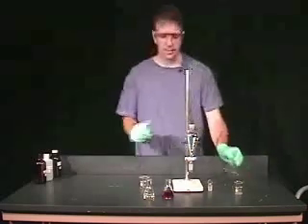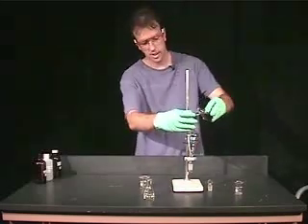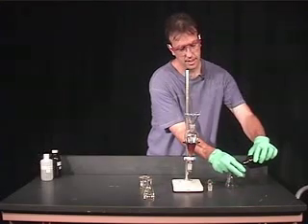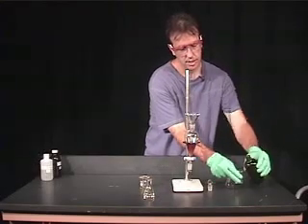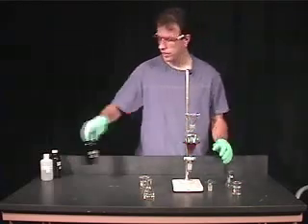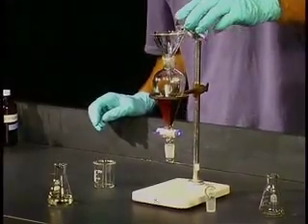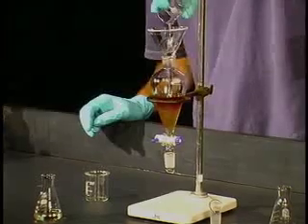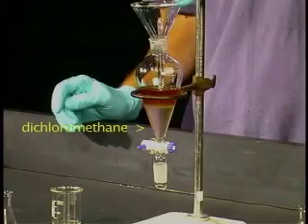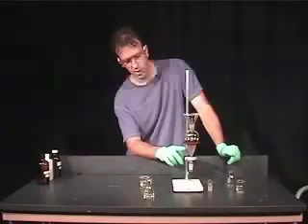I'm going to simply pour the tea solution back into our separatory funnel. Now dichloromethane has a density which is larger than water, so you're going to see a bit of a difference in this extraction. As you can see, dichloromethane is more dense, and it simply goes straight to the bottom of the separatory funnel.